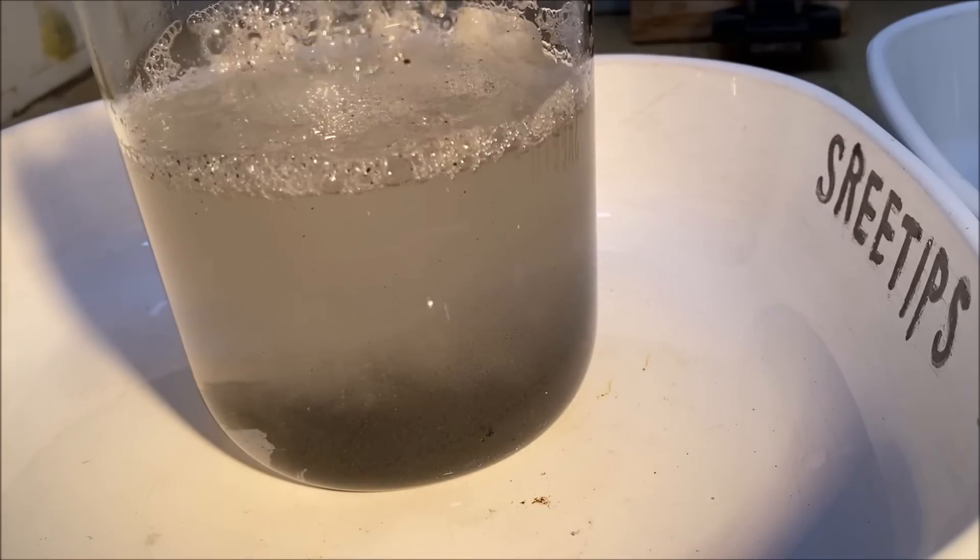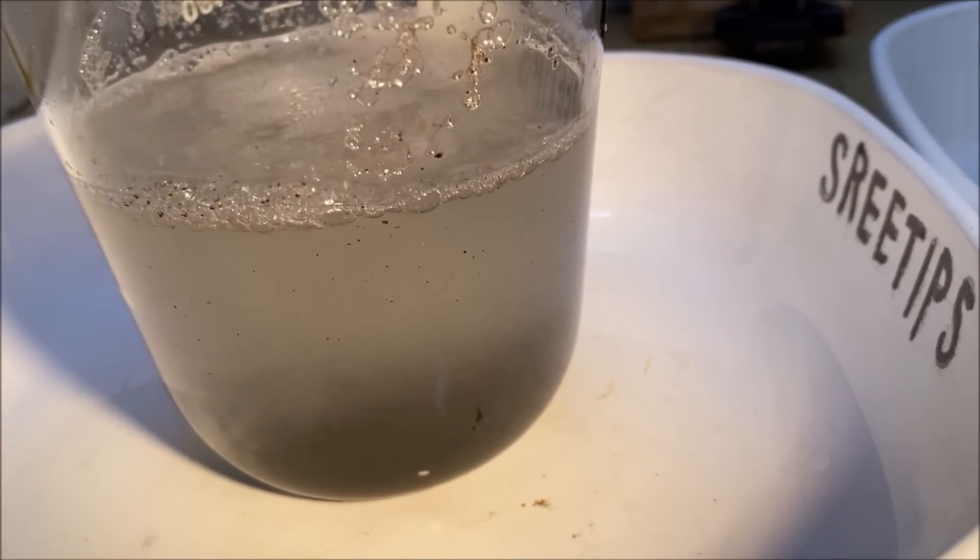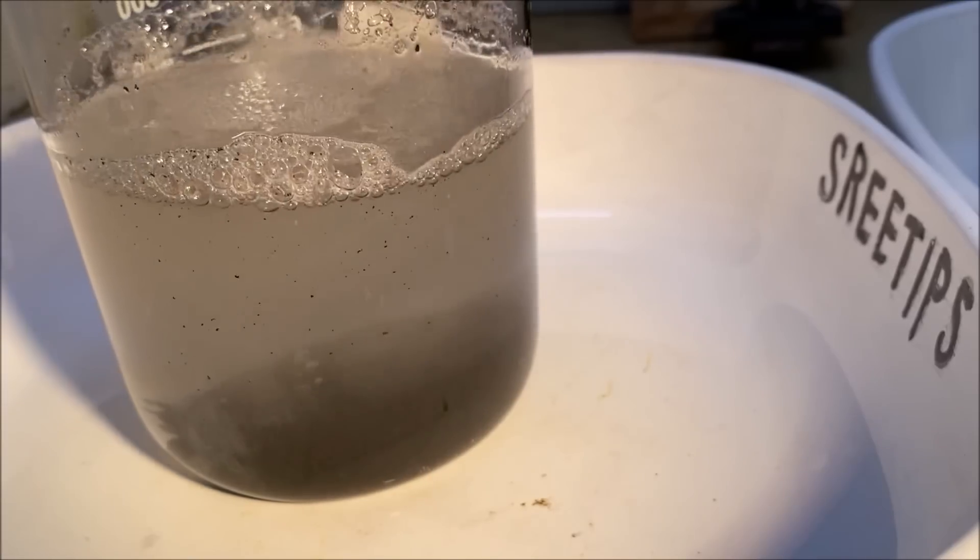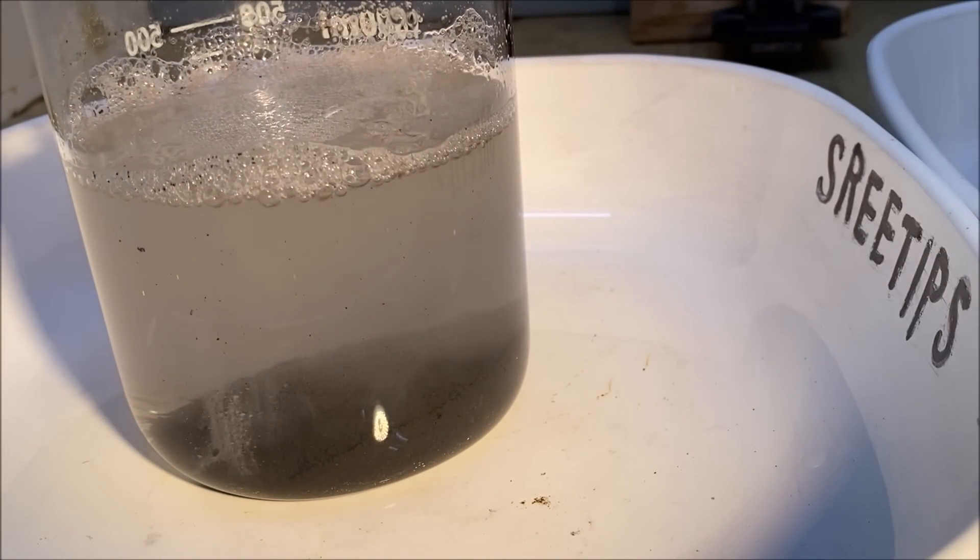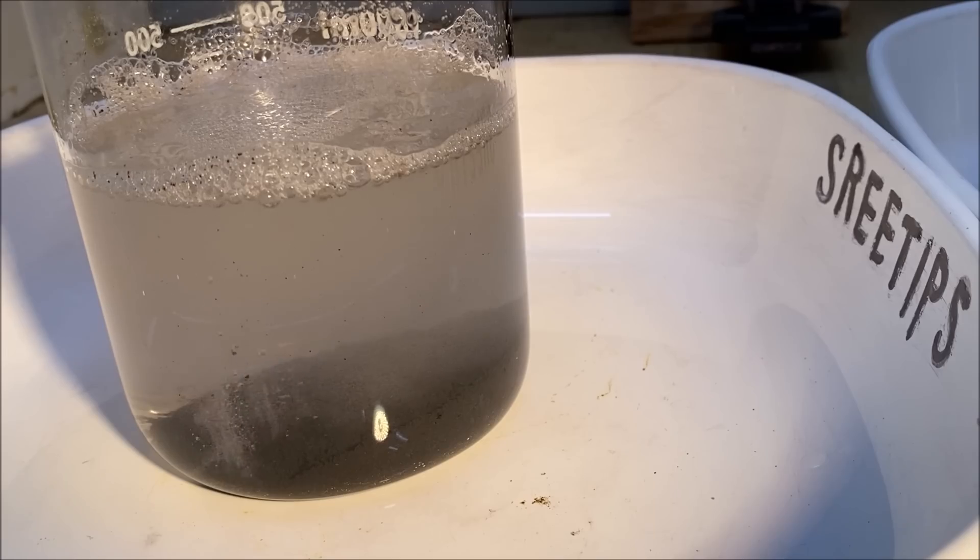Here you can see it's still got a little bit of zinc in there that's hot gassing. So we'll just let this continue to react.